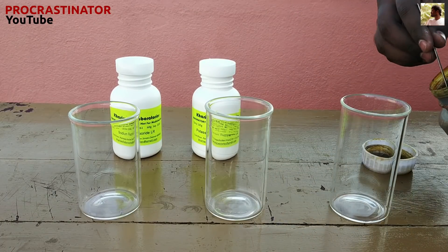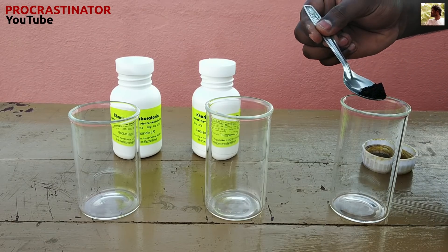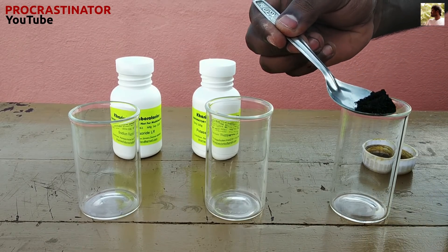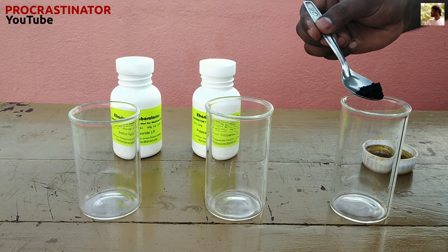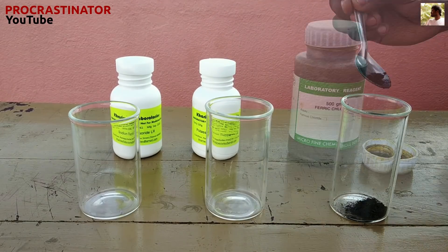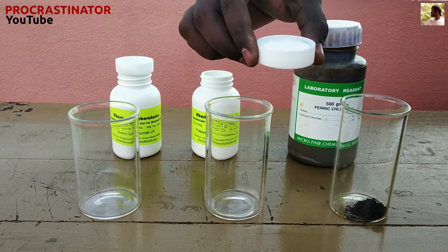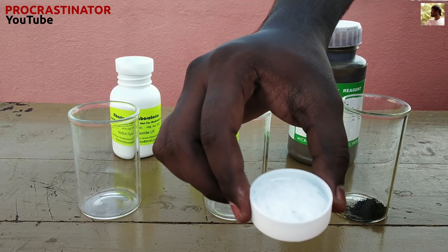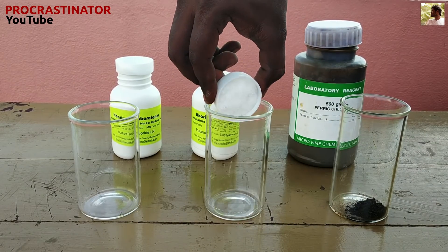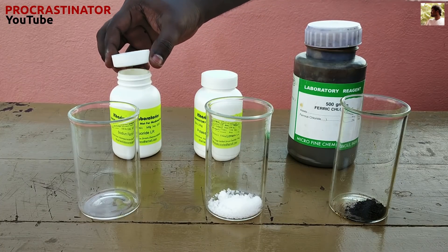Let's get ready the chemical solutions. Let's put them in 3 containers. Let's put ferric chloride in the first container. Let's put a few molecules of potassium thiocyanate. Let's put sodium fluoride in a little bit.